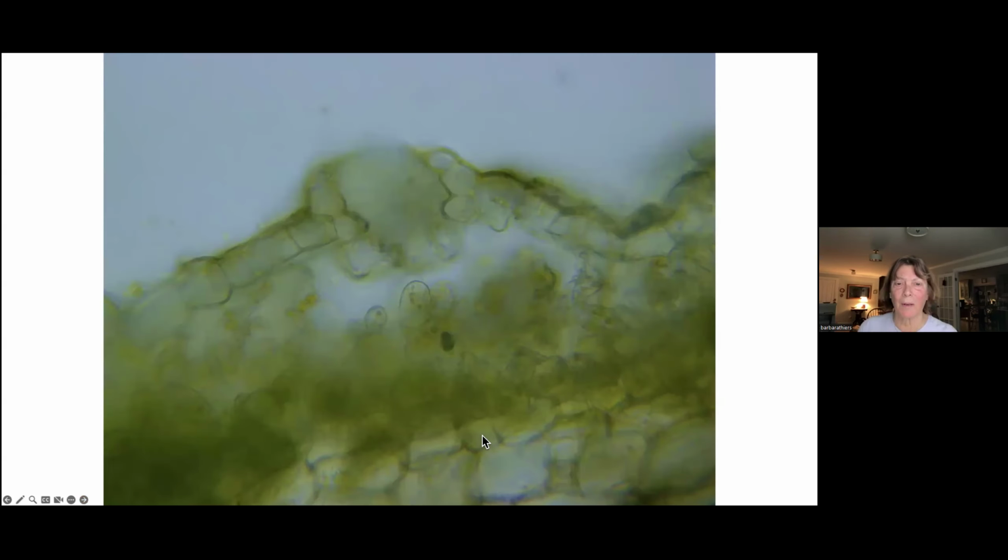And here's a better case where I got a section right through one. You can see here's one of these pores. There's a row of cells. They describe them as being barrel-shaped. And then down below, there's a chamber, kind of an open chamber, and growing out of those chambers are filaments. And that's enough right there to get me pretty far along in the identification.